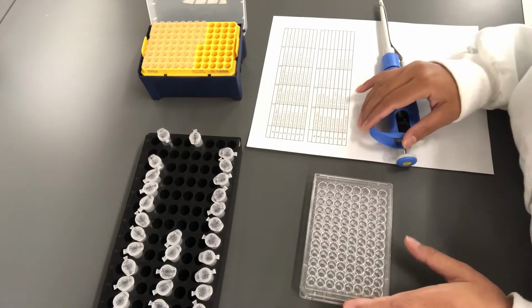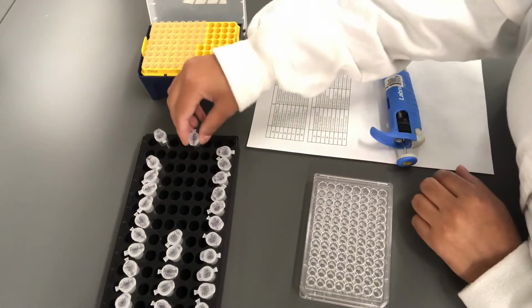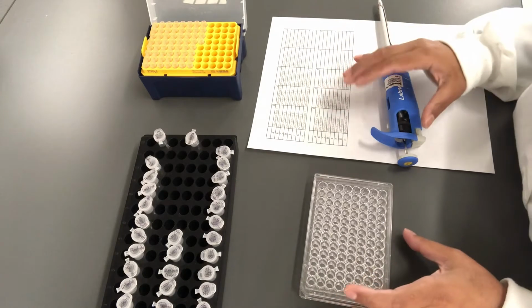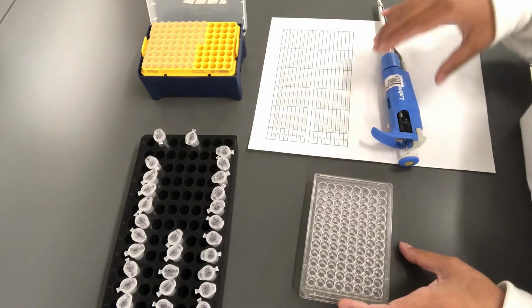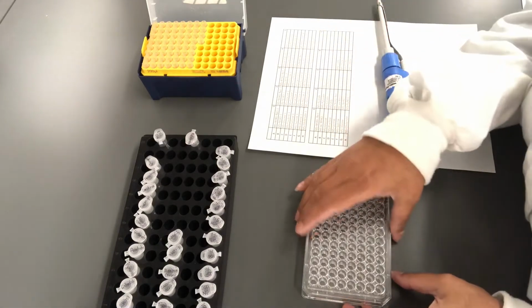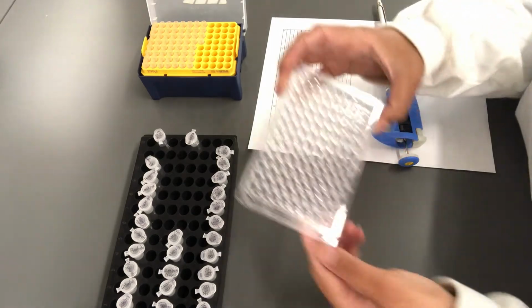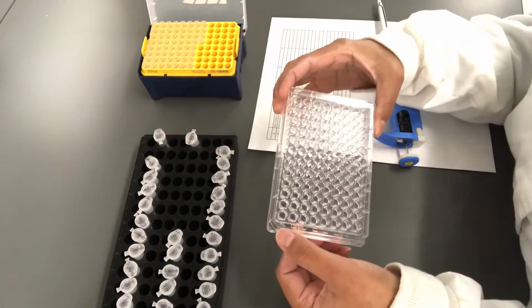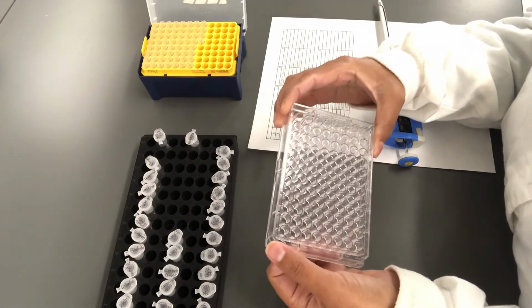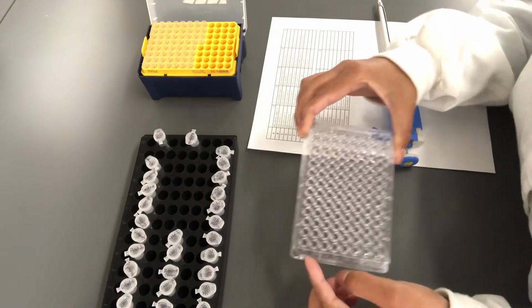In this demonstration, I'm going to use all the carbon, nitrogen, and stress factors, but I'm going to use Ralstonia as my only culture, but you'll still be provided with other cultures as assigned in your lab manual. So I'm going to start pipetting. If you look at the 96 well plate carefully, you can see it running from A to H vertically and 1 to 12 horizontally. Always start from the A1 side.